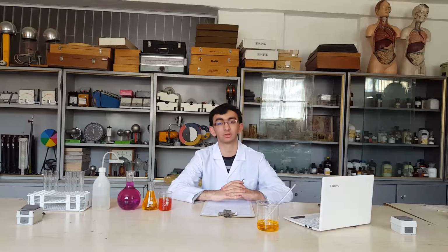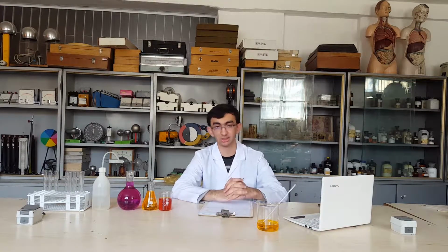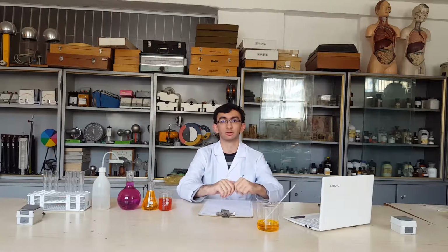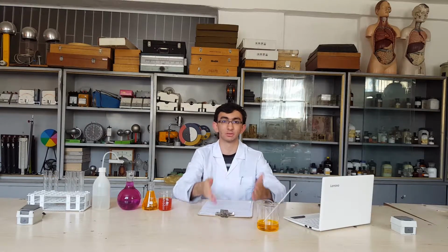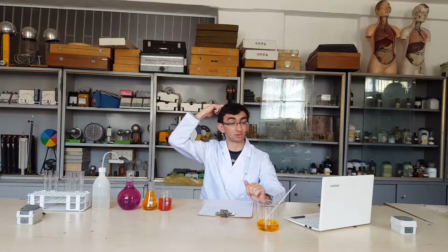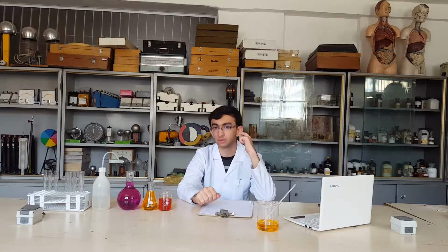Hello and welcome to our YouTube channel. Today we're going to run some experiments on oxidizing compounds and compare them. First, we're going to start with the weakest oxidizer we have, the water. First, we're going to react water with sodium and then heat the water up. After that, we're going to proceed to organic compounds and then last, inorganic compounds.